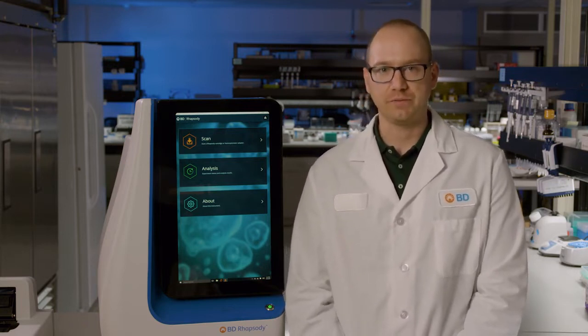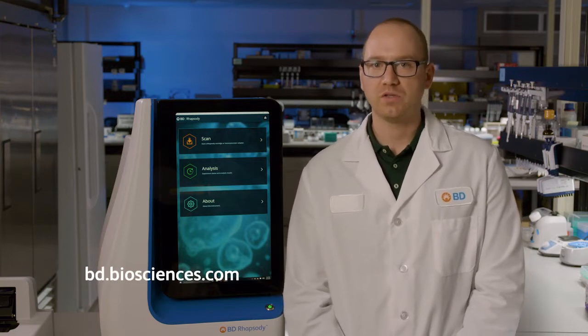to single-cell capture. If you want to follow along with our example, you can download the technical bulletin from our website. If there are no overlapping specificities between the fluorescent and oligo-conjugated antibodies, then you can proceed with your standard staining protocol or the one recommended in the technical bulletin. However, if using the same clone of the same specificity for both fluorescent and oligonucleotide-conjugated versions, we'll need to determine the volume of both antibodies so equal microgram quantities of each are used.